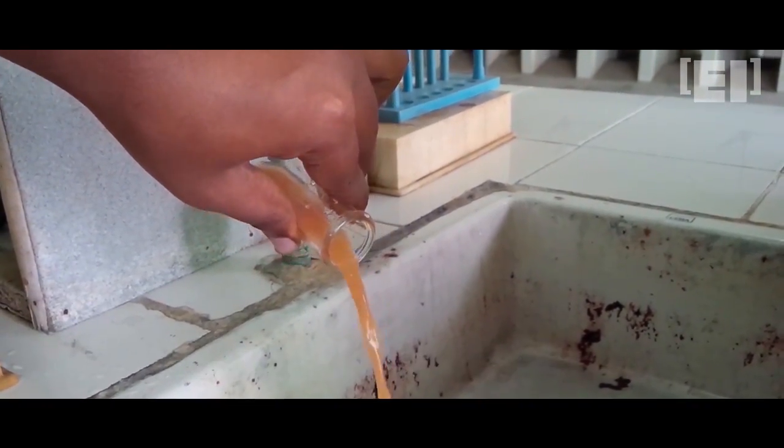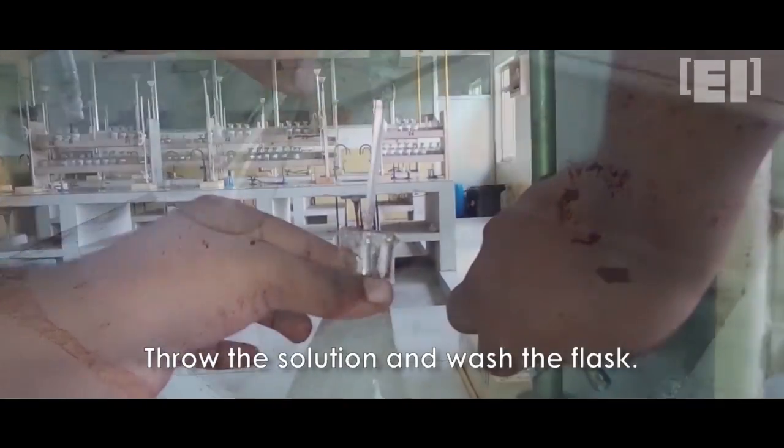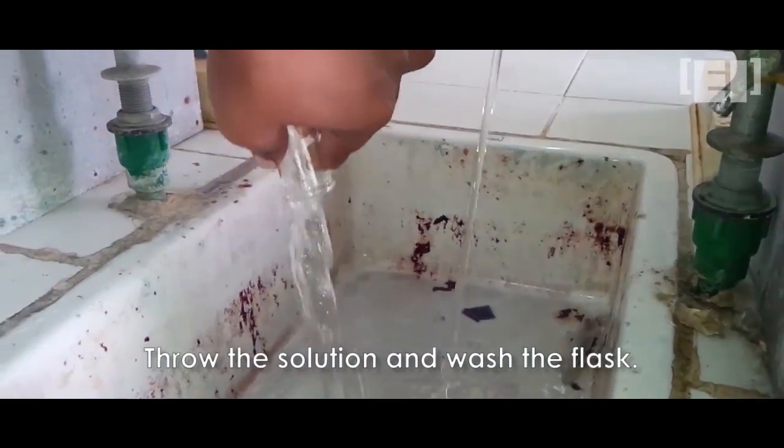Doing this for the last time. So washing of the flask and fill the burette again up to zero.